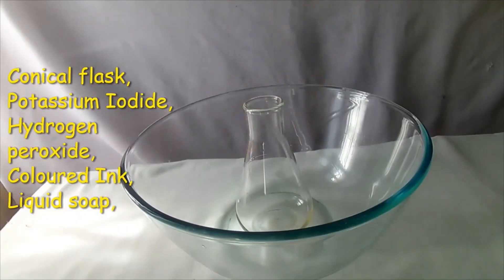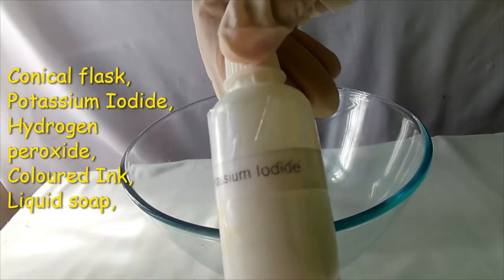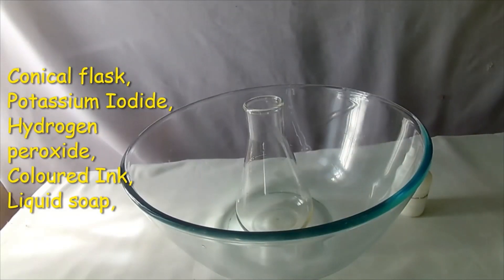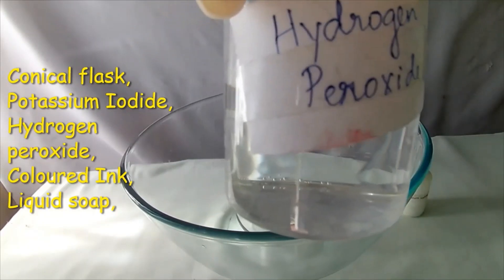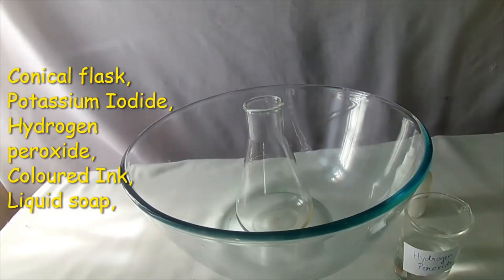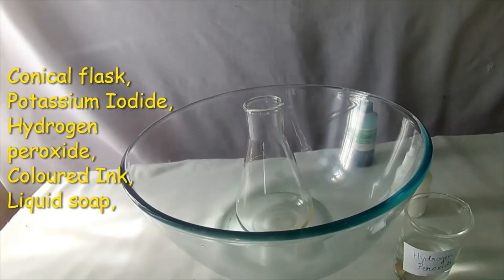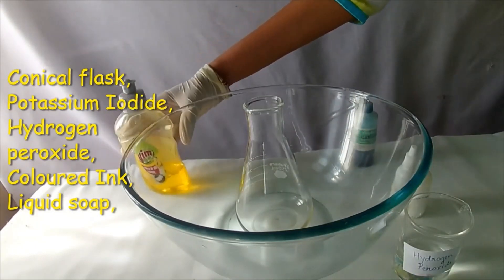Take a conical flask, potassium iodide, hydrogen peroxide, ink, and liquid soap.